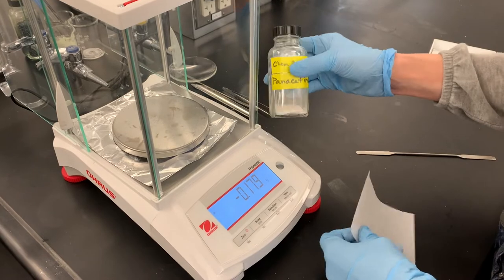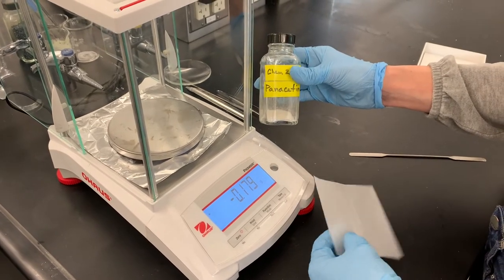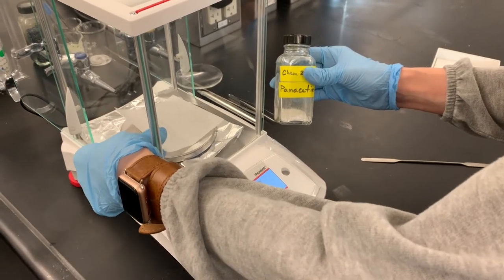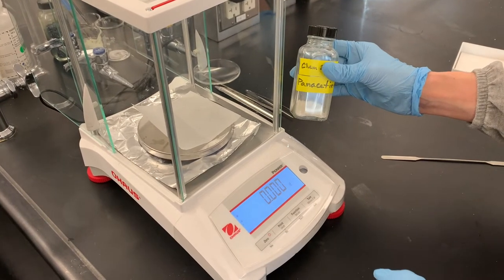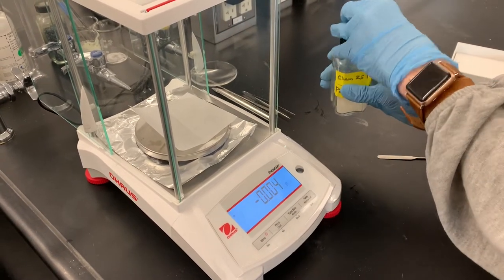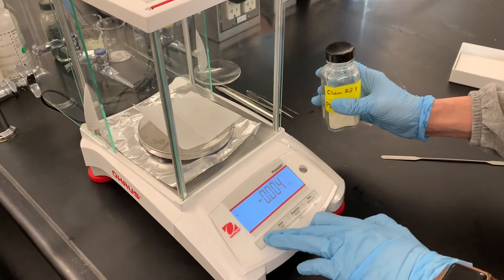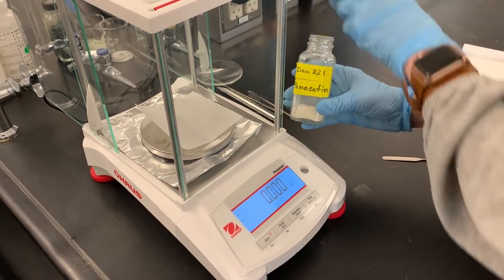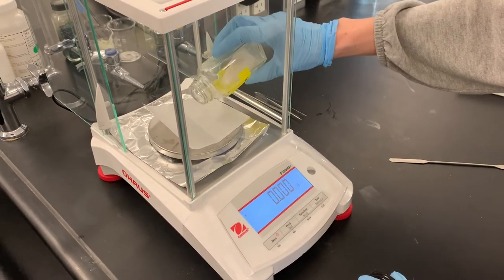We're going to use about three grams of panacetin for this experiment, so I'm going to begin by weighing approximately three grams. It doesn't matter exactly how much we have — we just want to be in the ballpark of three grams.